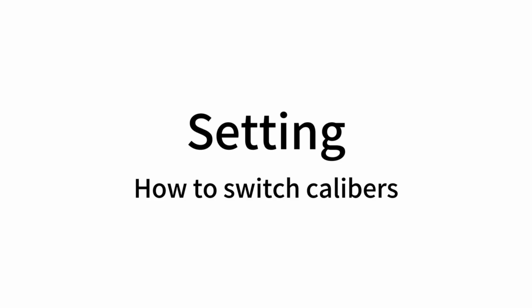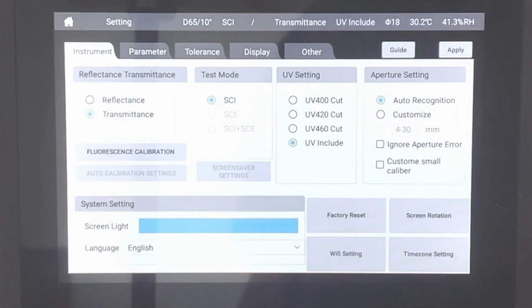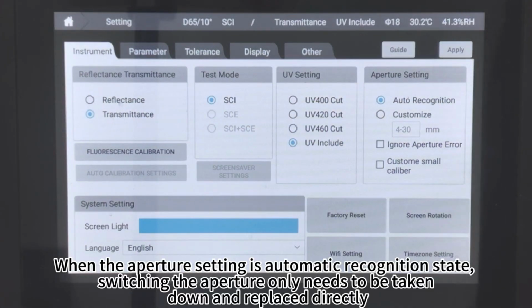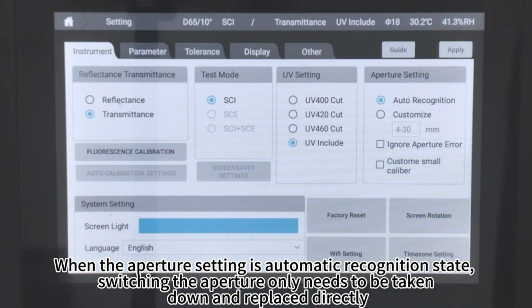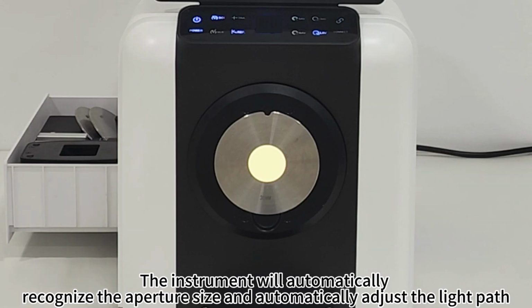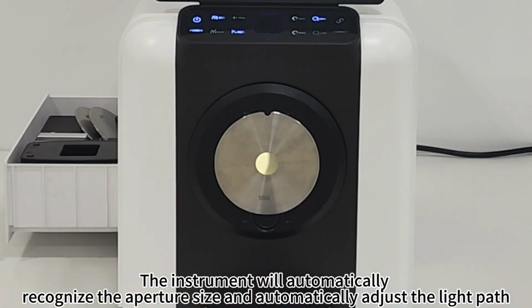Setting. How to switch calibers. Click Setting. When the aperture setting is automatic recognition state, switching the aperture only needs to be taken down and replaced directly. The instrument will automatically recognize the aperture size and automatically adjust the light path.